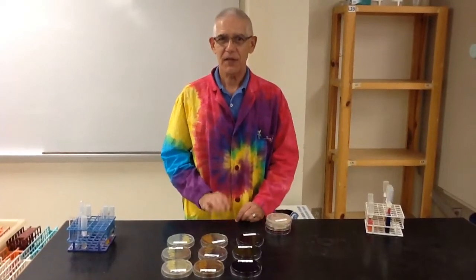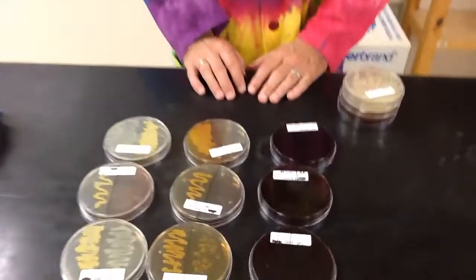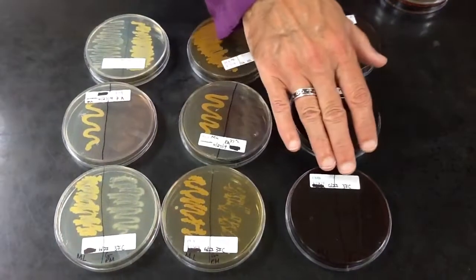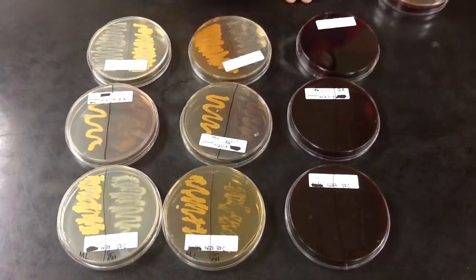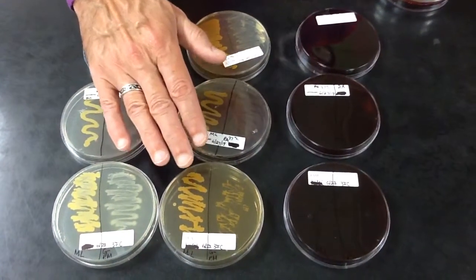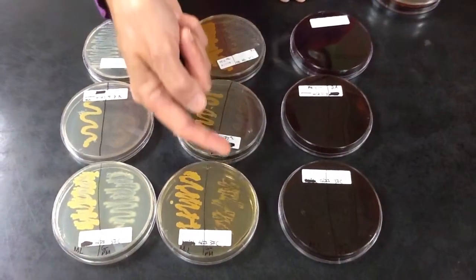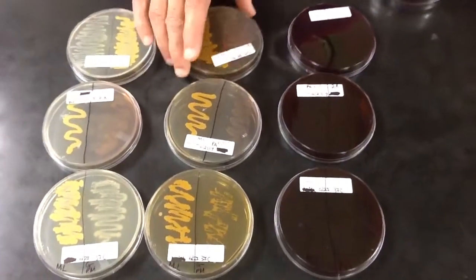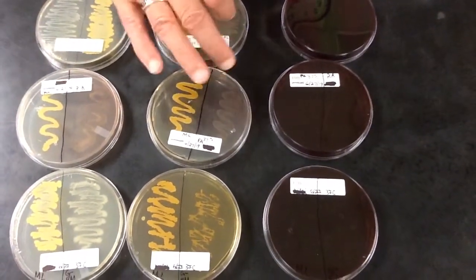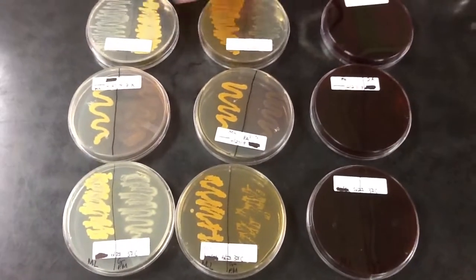Today's video is going to talk about a couple of differential plates that you can use specifically for your unknowns, and those are PEA and EMB. We have a couple of different examples here, but the idea is that PEA will actually inhibit DNA synthesis of gram-negative bacteria. On this side here, gram-negative bacteria is being represented, and you can see that there is an inhibition that takes place.